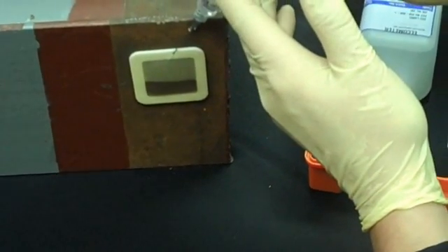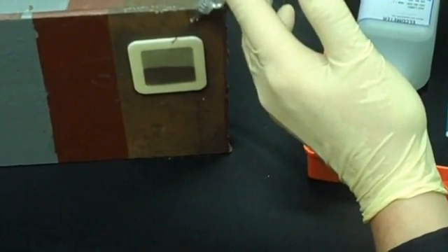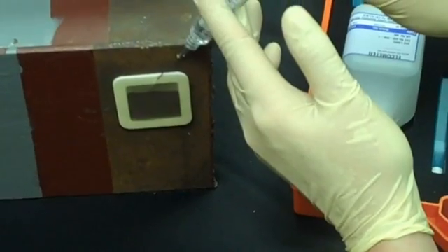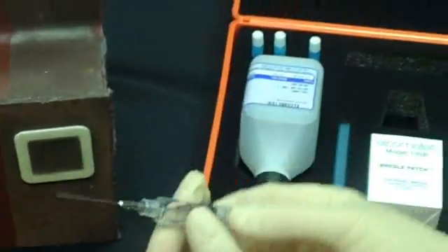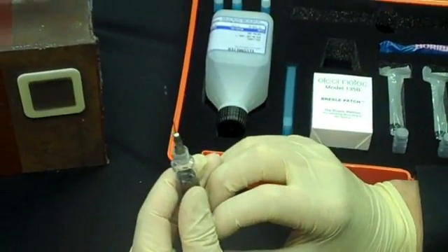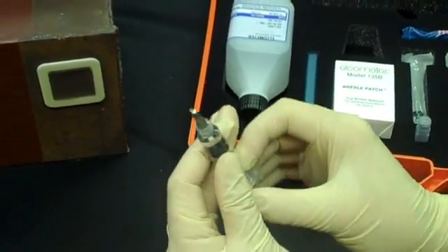Reposition the needle. We'll pull out any air, just trying to expose as much surface area as possible to the water. Push out the air from the syringe.